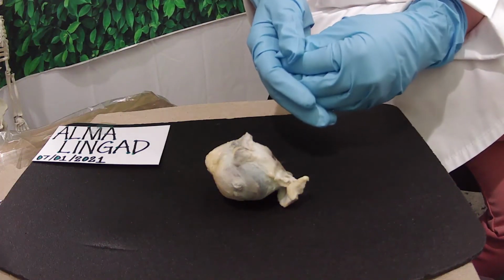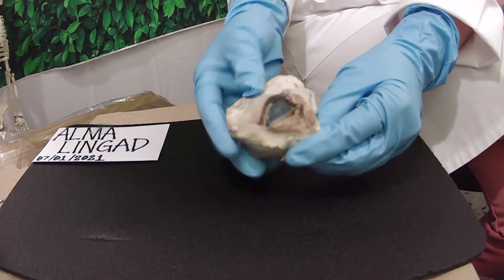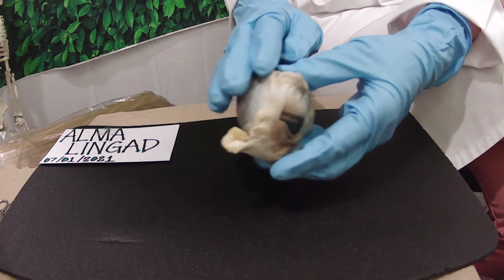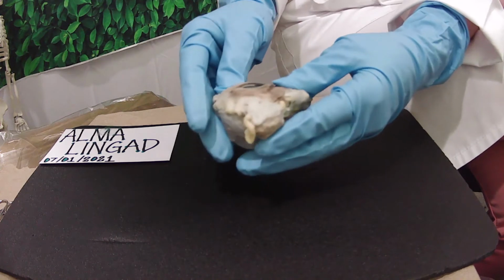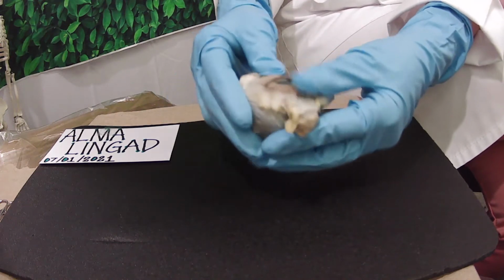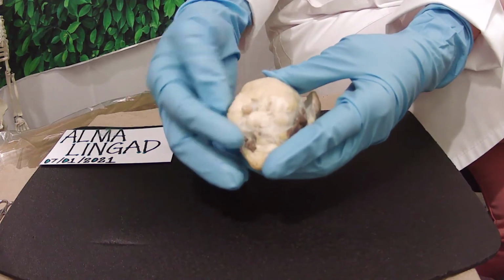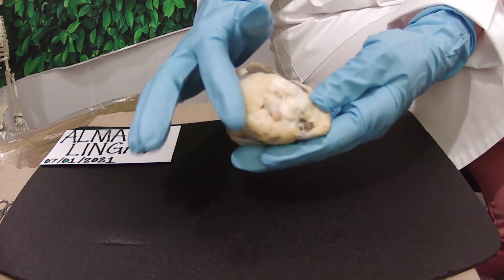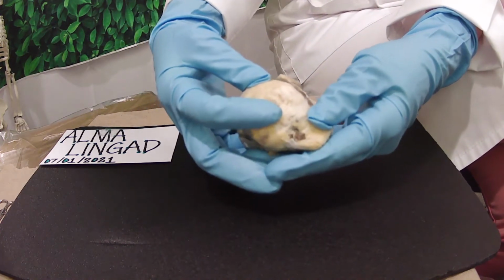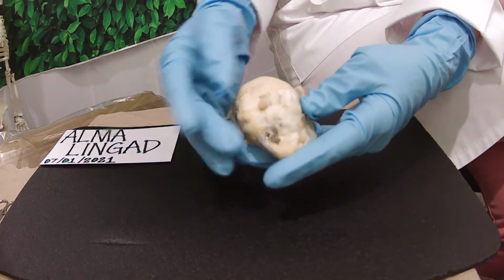Before we proceed to cow's eye dissection, we have to make sure that we wash it in cold water and wipe it with paper towel, which I already did. As you can see, the cow's eye is covered in fat and muscles that are connected to the eye. Let us locate the optic nerve. It's going to be on the posterior side of the eye cavity. So this is the optic nerve that is protruding out of the posterior portion of the eye, like I said.